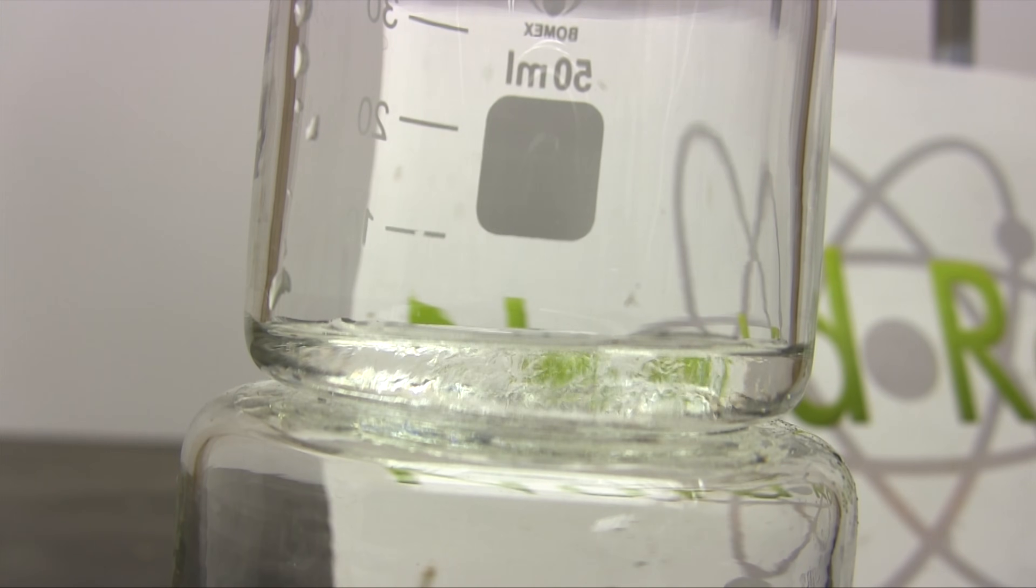Here's a clip of the distortions from my previous video on distilling sulfuric acid. As you can see at this time the sulfuric acid was still boiling off the water and so the acid distilling over wasn't at the maximum concentration yet. If you see something like this then keep boiling and changing out the receiver every so often until it becomes a constant density.